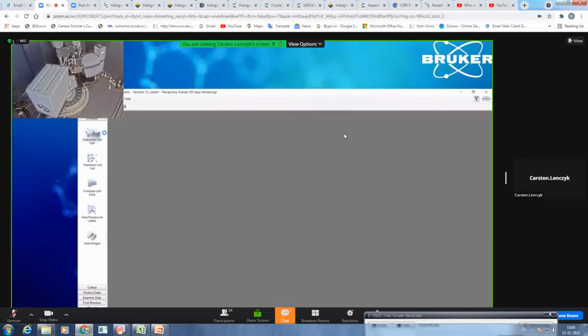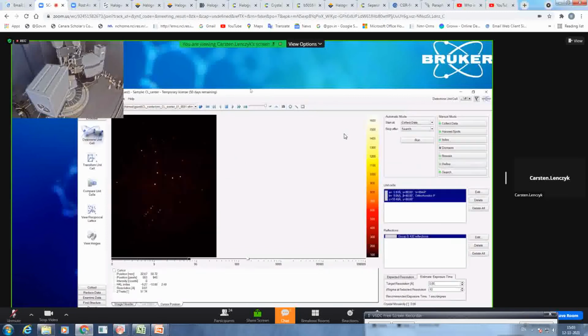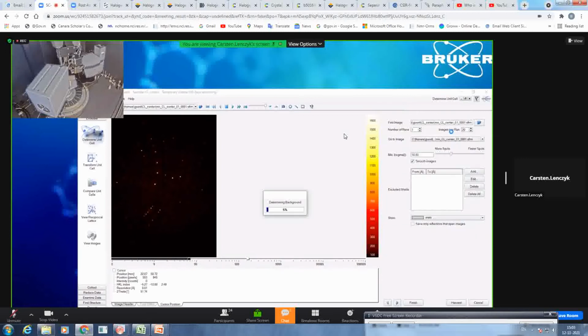So what we now do is we go to the determine unit cell. You see the solution from the last time we did this. So I delete everything, so we go step by step. So it automatically loads in the frames or images it finds. So we have this name. This defines the run you're currently using. So it's the first run and it starts with the first frame.